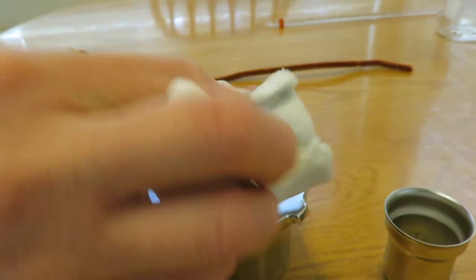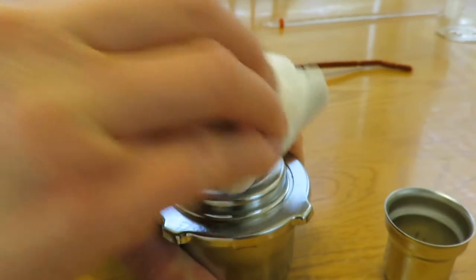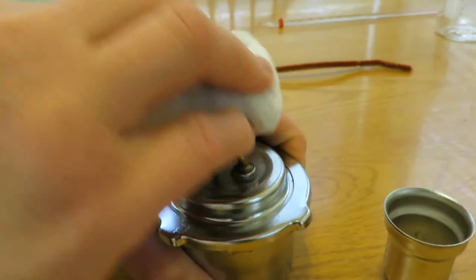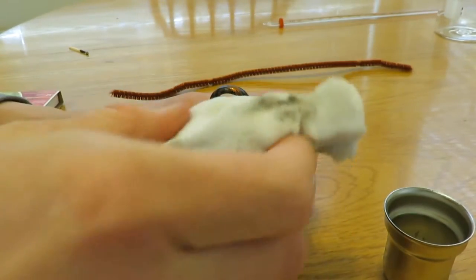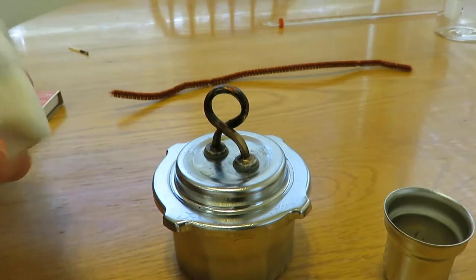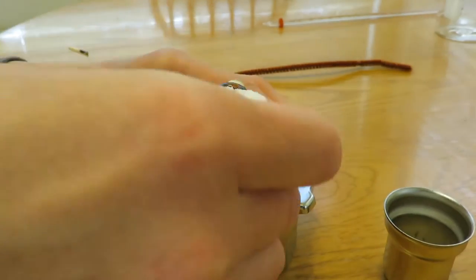The magic eraser can clean it up to the best of your ability. You have to squeeze it in there.